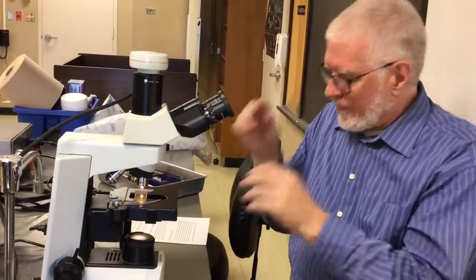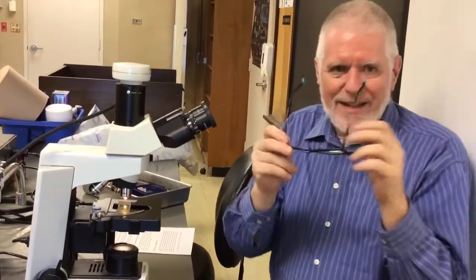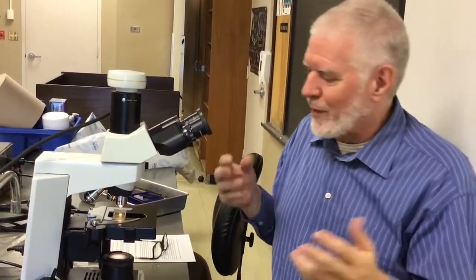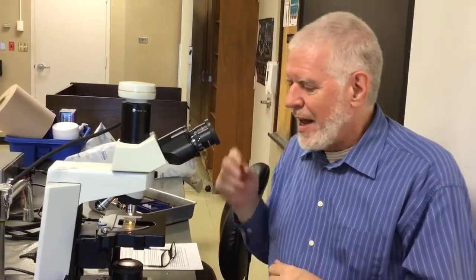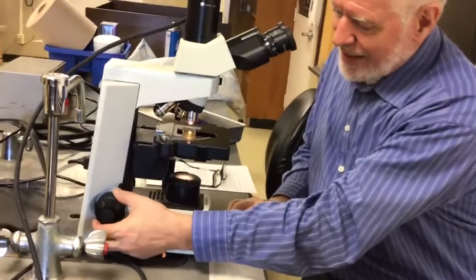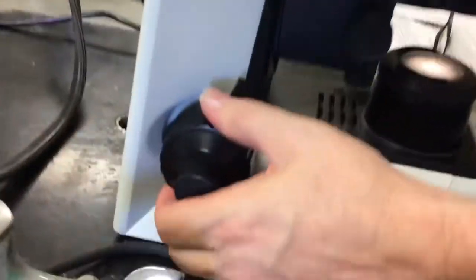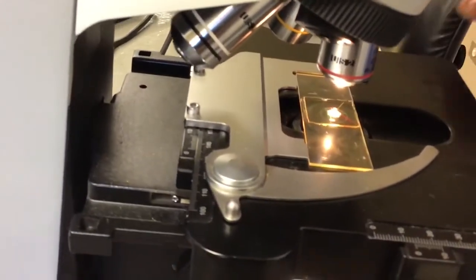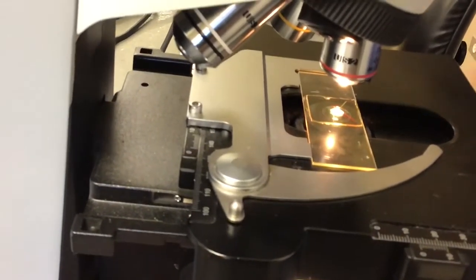So I've got this under here. The way to focus it, and I let the microscope be my glasses, so I always focus it with my glasses off. It's not necessary, you can focus it with your glasses on, it doesn't really matter. I'm just used to doing it this way. These are your focal knobs. There's a big one on the outside, that's the coarse adjustment. It moves the slide a lot once you get it pretty close to being in focus. Here, you move the coarse one again so I can show the slide moving.